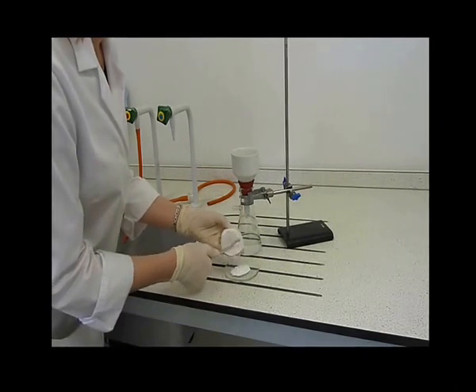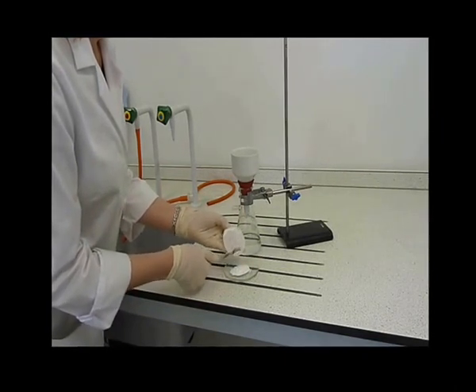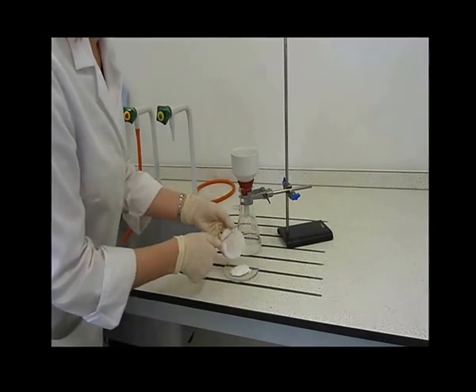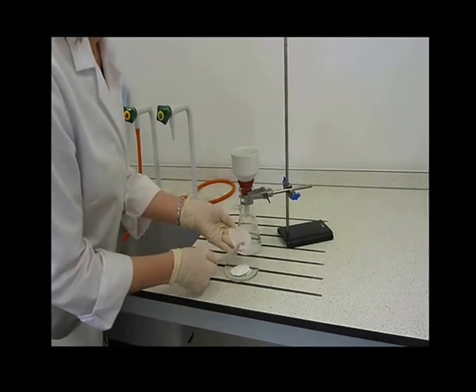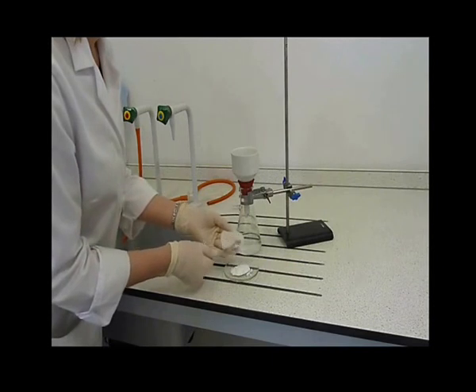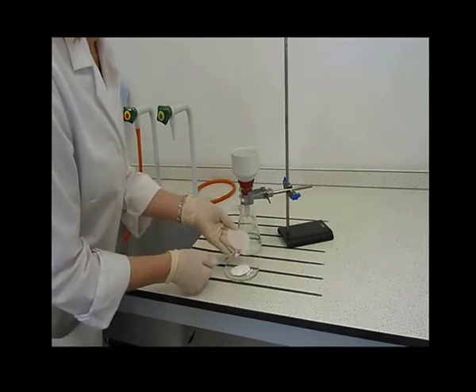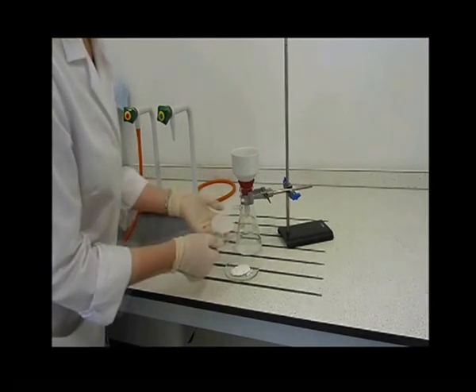Check the filter funnel to ensure that the entire product has been collected. If required, place in a warm oven to dry before calculating your percentage yield and obtaining the melting point. Alternatively, collect your filtrate if this is your desired product.